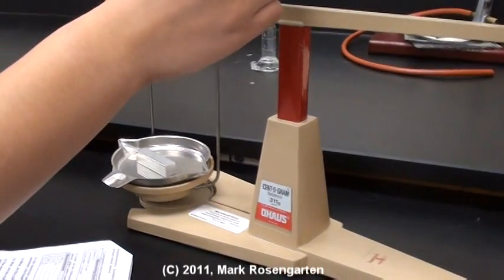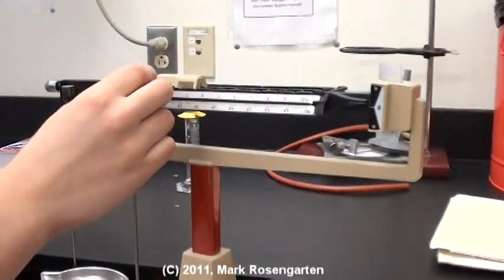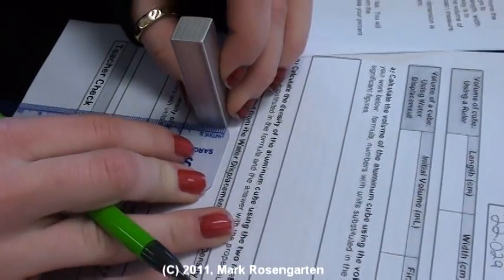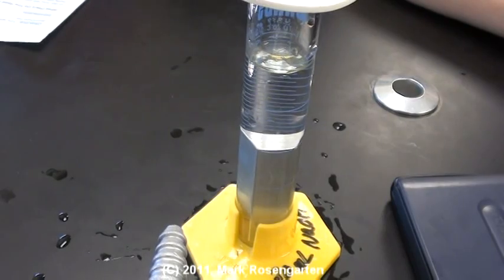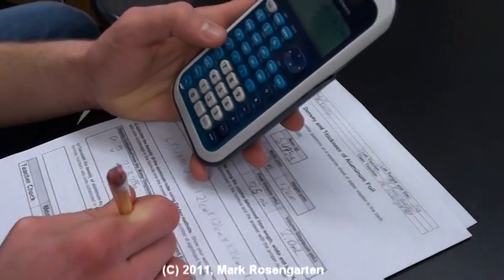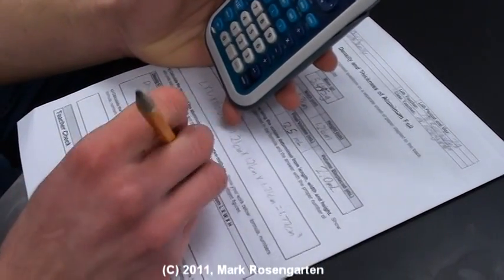Once you have the density, you're going to need to do a little bit of algebraic trickery, because you can use the density of aluminum along with only a few measurements of this piece of aluminum foil and end up with the thickness of the piece of aluminum. Your first step is to record the mass of your piece of aluminum. Then measure the length, width, and height of your aluminum cube or block. Slide the piece of aluminum into the water and record the new volume. Once you've finished with the measurements, you can start working on the calculations.